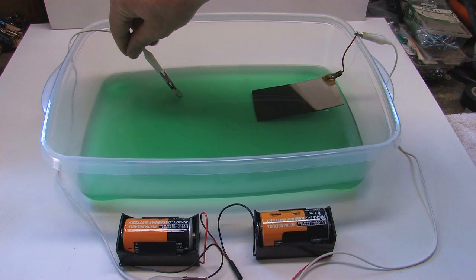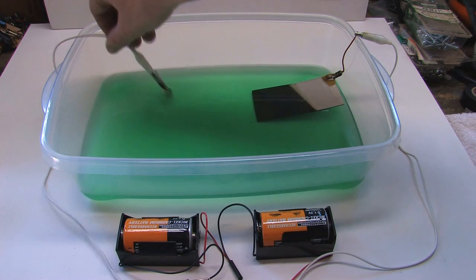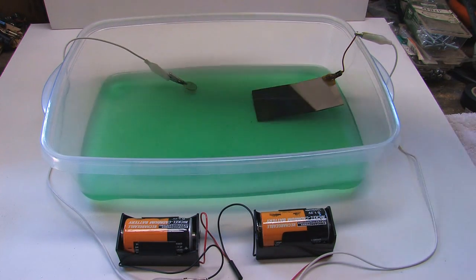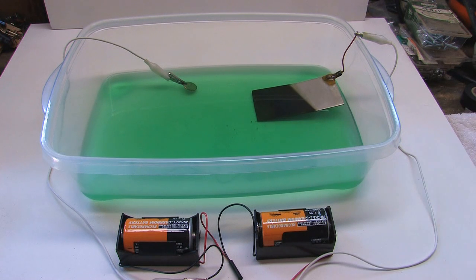As you can see, I'll go ahead and let that stick out a bit. I have two batteries, just a couple of D-cells. Everybody I know that does these nickel plates always uses things that plug into the wall, as far as something like 12 volts, something like that, and a very high amperage to bring it across.